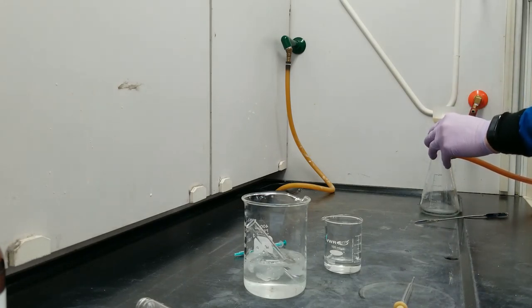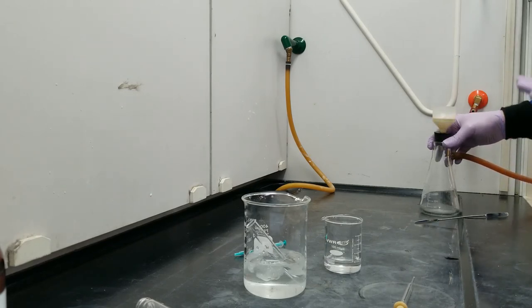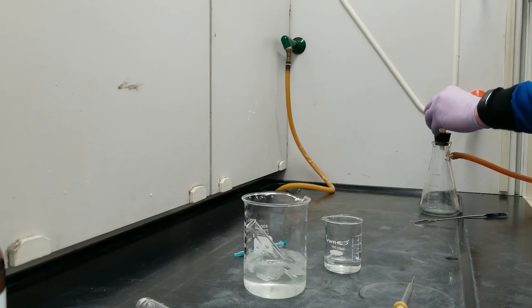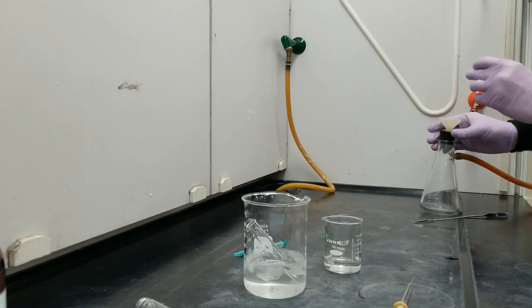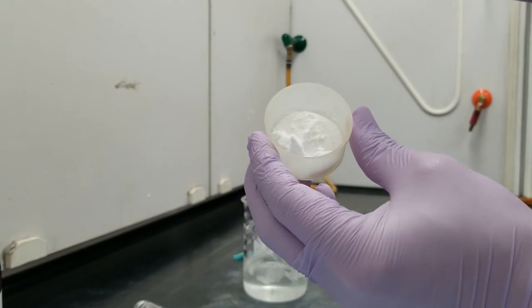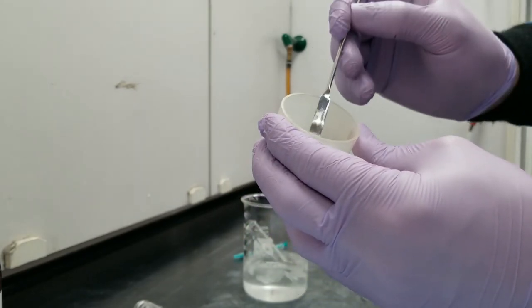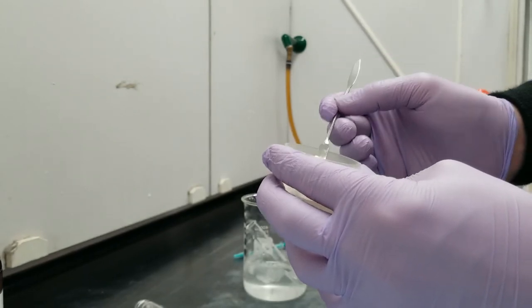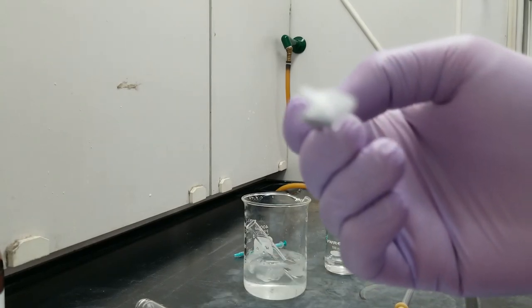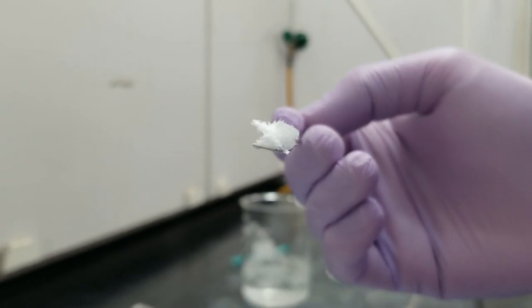If we were drying this product of water, it might take, you know, 15-20 minutes, but we were drying petroleum ether and diethyl ether, which are super volatile on their own. So this is already dry. I'm actually going to go ahead and kill my vacuum. And my product is a powdery, very light, feathery solid. It's got very, very fine little points.